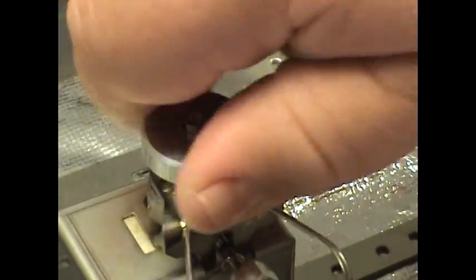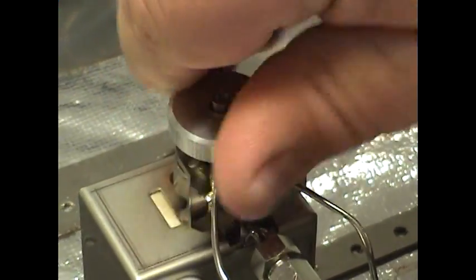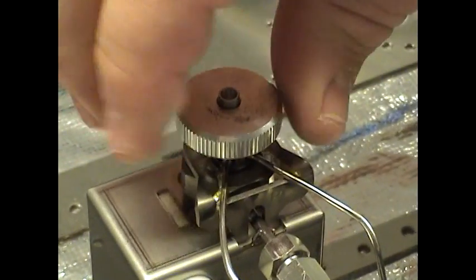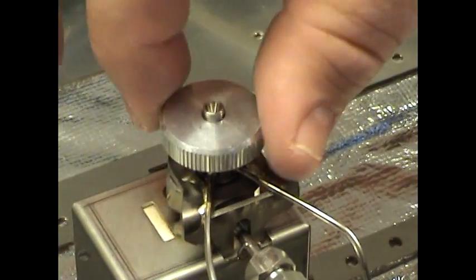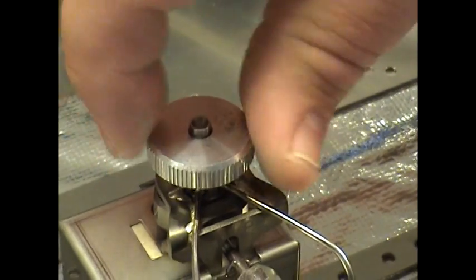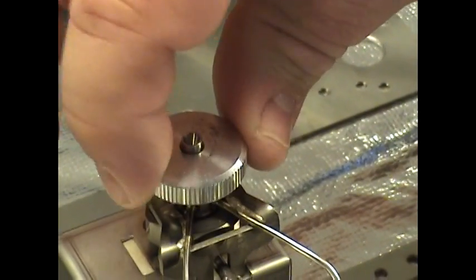Place the injection needle guide on top. Screw the knurled nut all the way down. Back it off approximately one half to a full turn. You do not want it tight and you do not want it too loose. It should have some play to it.